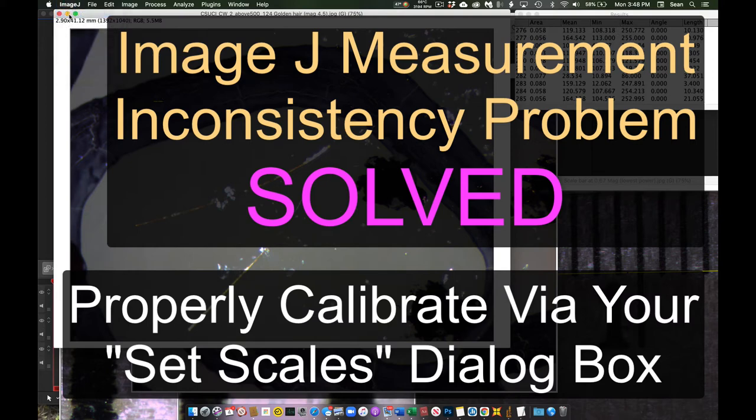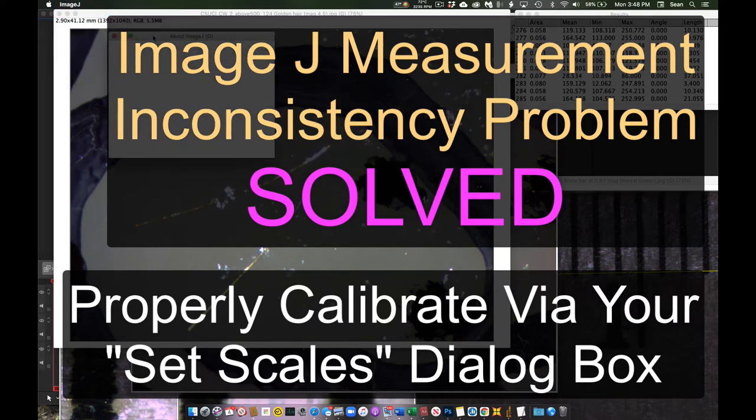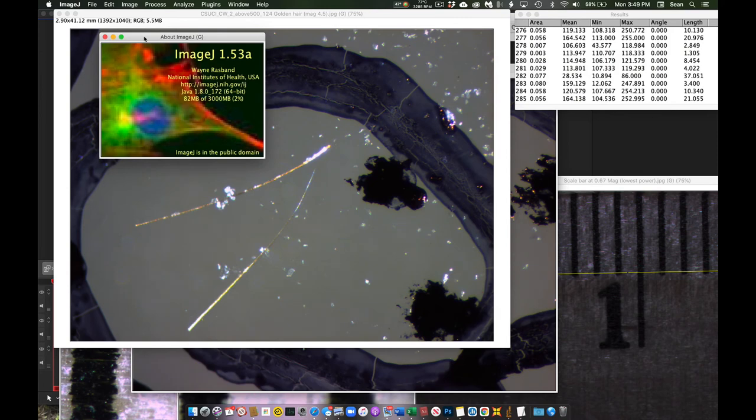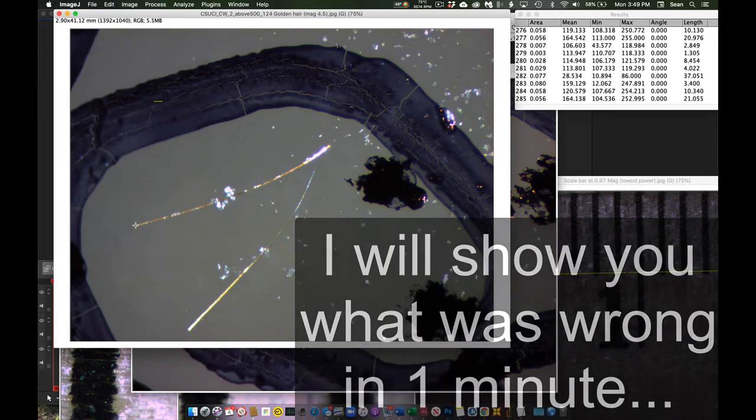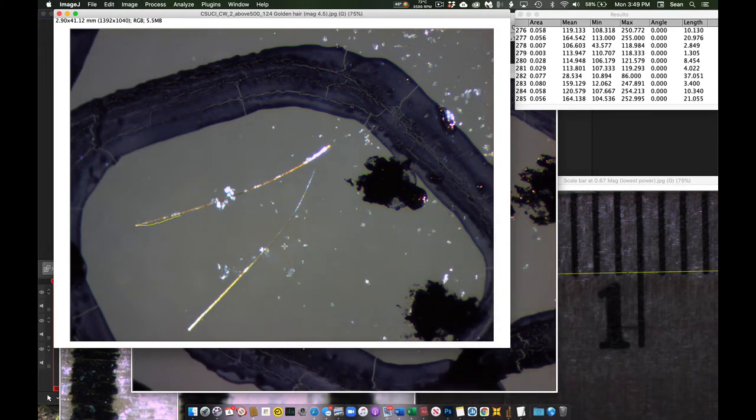So just wrapping up my analysis here, and a little bit concerned that there's something apparently not right with ImageJ. I'm using ImageJ 1.53 on my Mac. I downloaded this current version in December of 2020, and so it's the most recent version. I've calibrated the scales. And so these two fibers, which are probably human hairs, but they're about the same length.